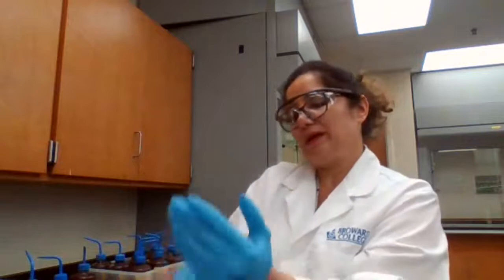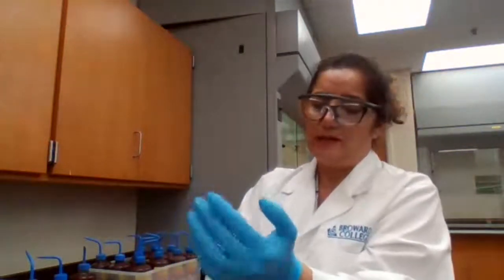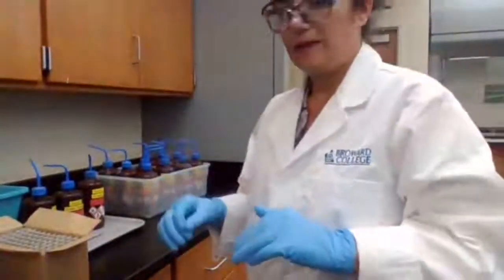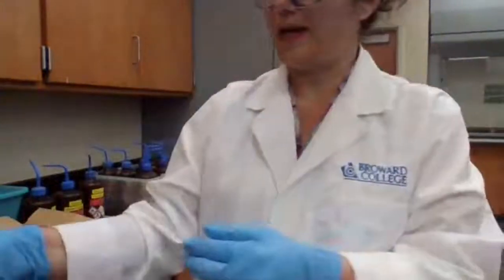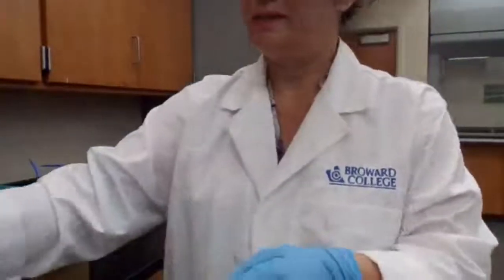But if I know my chemicals, I already look at the risk and the hazardous data sheet, the MSDS sheet for them, then I can live without it. But some of the experiments require strong acid, strong base, or corrosive compounds. I definitely have to use gloves.